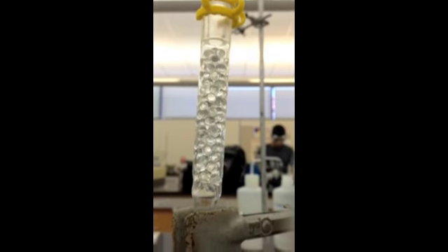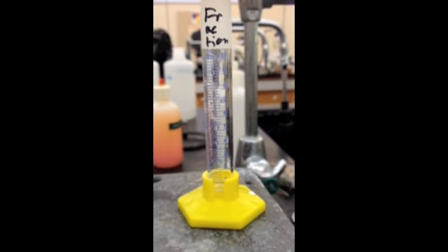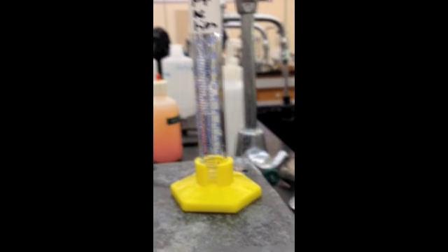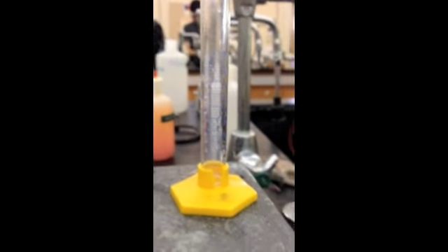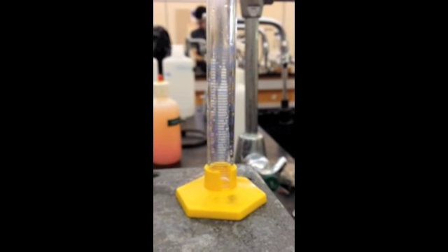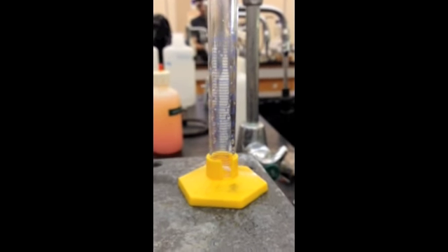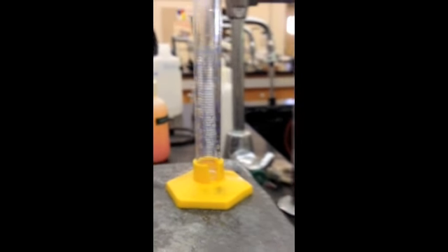Again, you see the vapors moving up the column. Now, what you want to do is when you get to a certain mark, let's say four milliliters, you will switch this graduated cylinder with another graduated cylinder and collect a fraction for gas chromatography to analyze at what point the mixture separated.